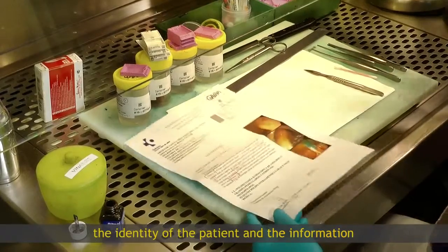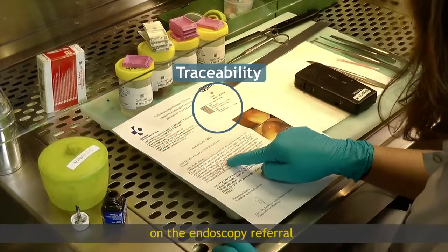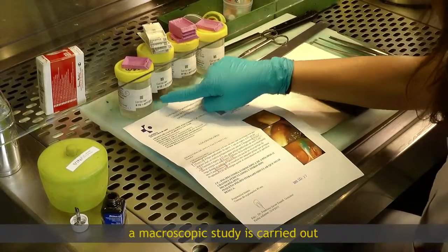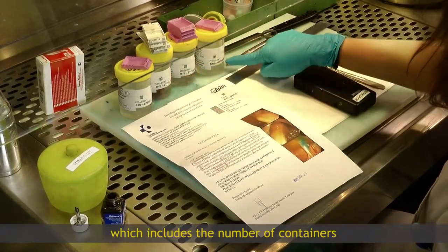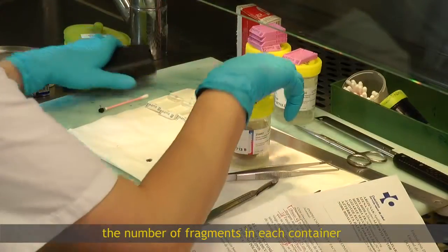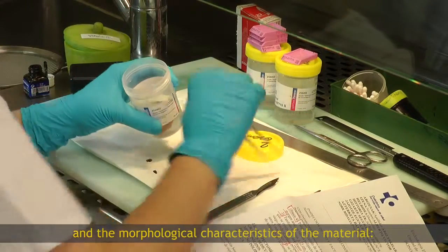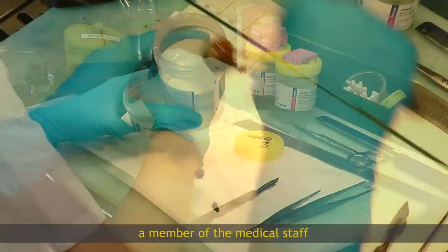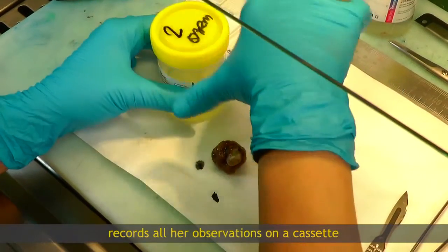The identity of the patient and the information on the endoscopy referral are checked again to see if they match. A macroscopic study is carried out, which includes the number of containers, the number of fragments in each container, and the morphological characteristics of the material — size and shape. A member of the medical staff records all observations on a cassette.